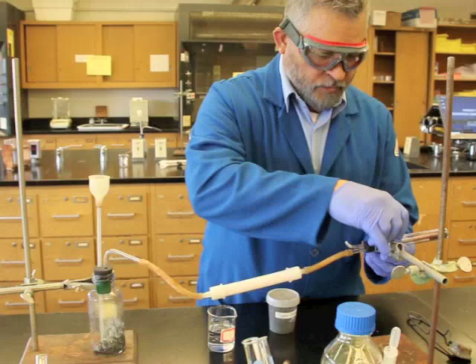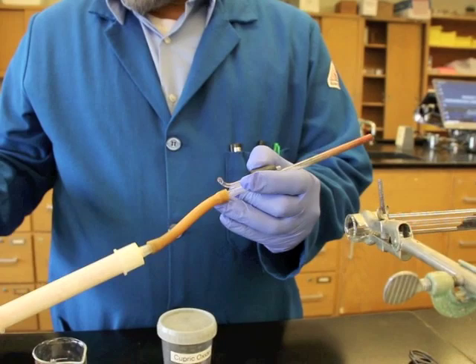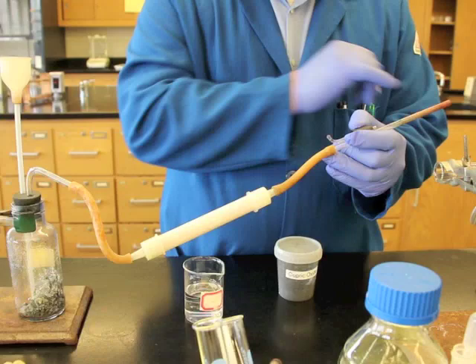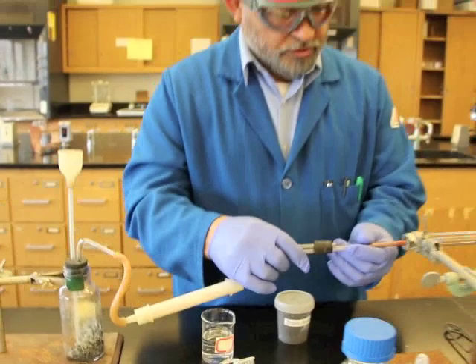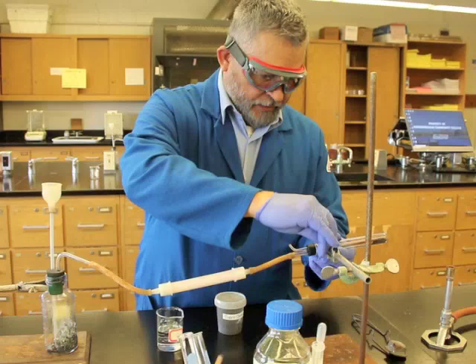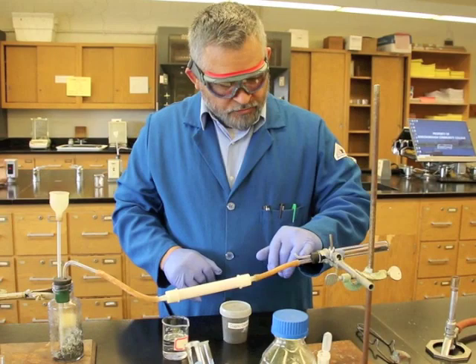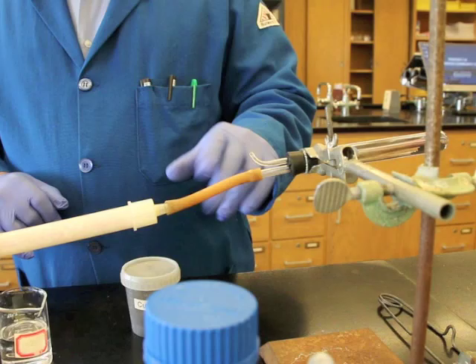We have the tube passing through this apparatus — it goes over here. The tube brings the hydrogen gas from the gas generator to here. We also have a small tube right here that goes inside, like that. It is clamped next to the rim of the test tube. This piece of tube — this nozzle — points up. You will see later the function of that.